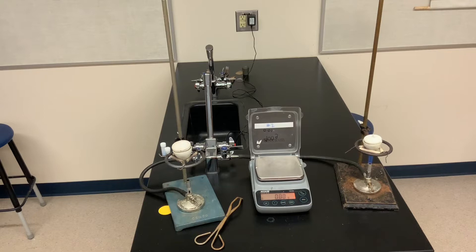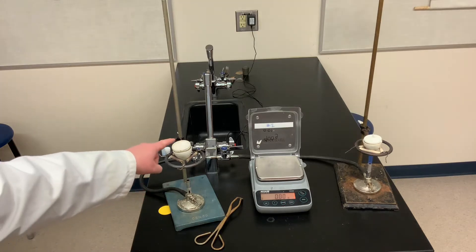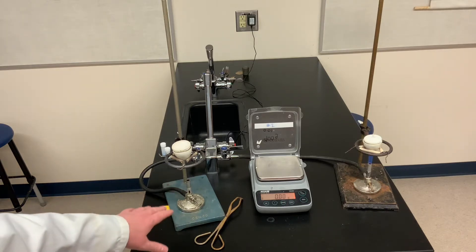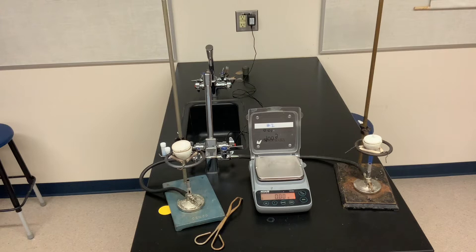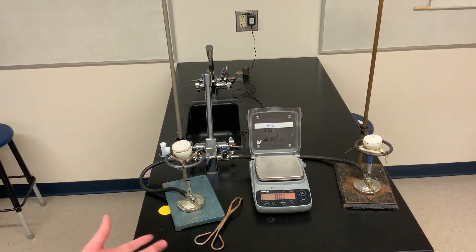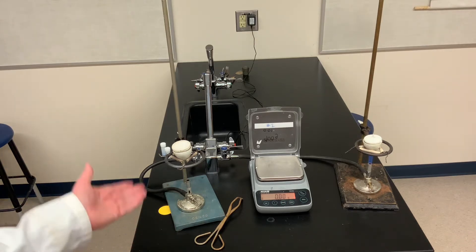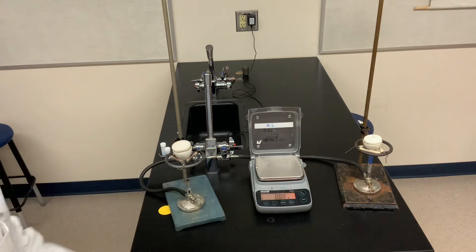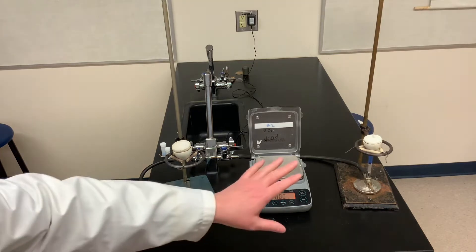So I've just come back after about six or seven minutes of heating, and I've turned off one of the burners because there's a little bit of evidence of some smoke coming out of the crucible. So it's possible that even though I had it pretty high up in the flame, that it is actually starting to decompose the copper sulfate salt. If that's occurring, then more than water would be escaping. So keep that in mind in the first sample, that it's possible that it partially decomposed. Now I'm going to keep heating the other one because it's got a bit of a gentler flame.